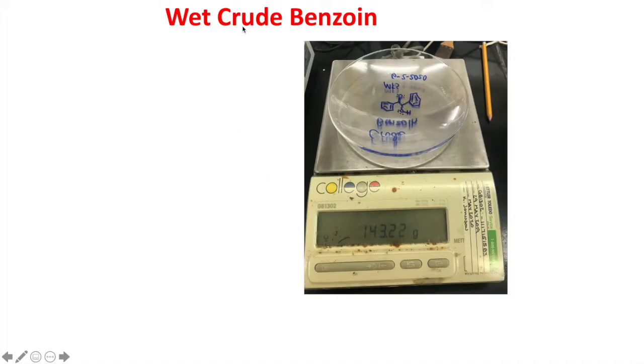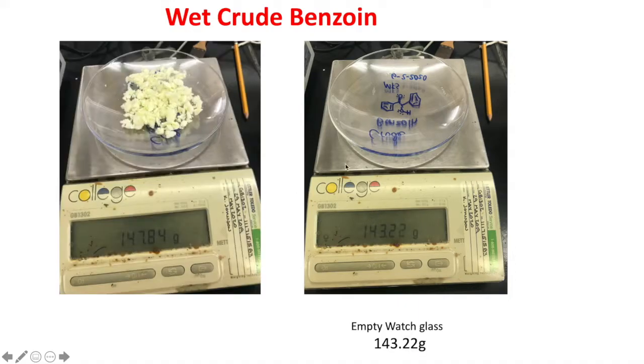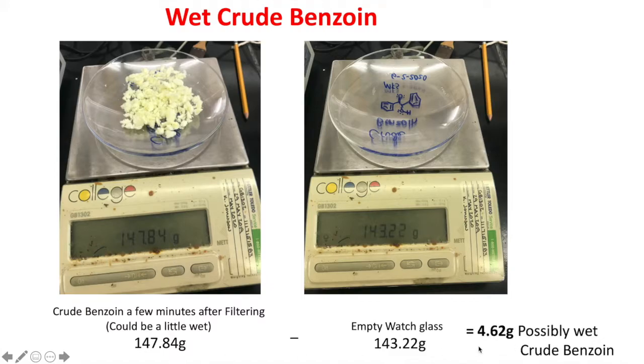When we left off last time, I was telling you that the crude benzoin was probably wet. So we have the mass of the empty watch glass. We put the crude benzoin on, and it was only a few minutes after it was filtered, so it probably had some ethanol and water on it, and it weighed that much. So we got a possibly wet weight of 4.62 grams of the crude benzoin.